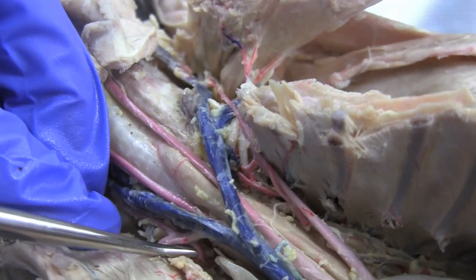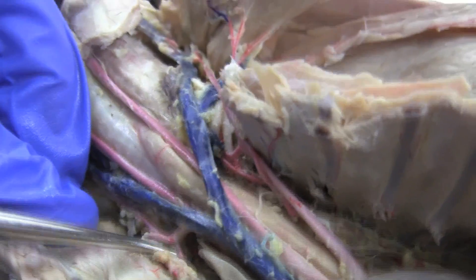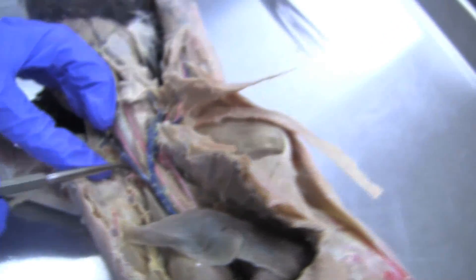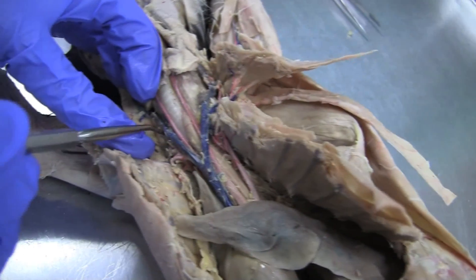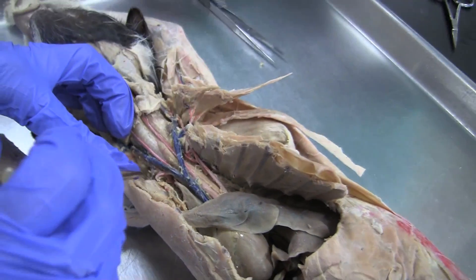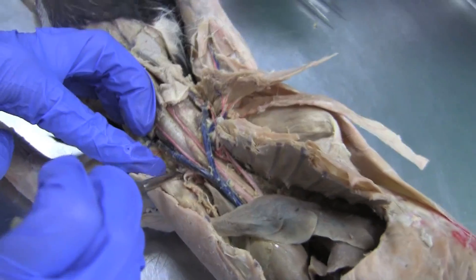Let's see if you can pull it out a little bit — see, there's two. The costocervical one is in the back. And then this one coming up is your thyrocervical, and that one's always going up. And then that's your little axillary artery.